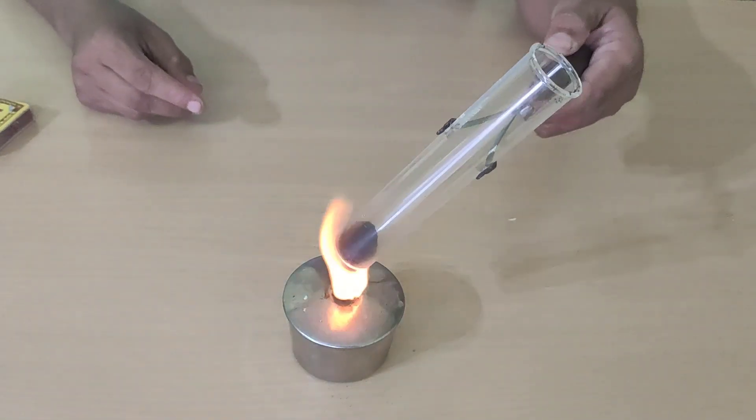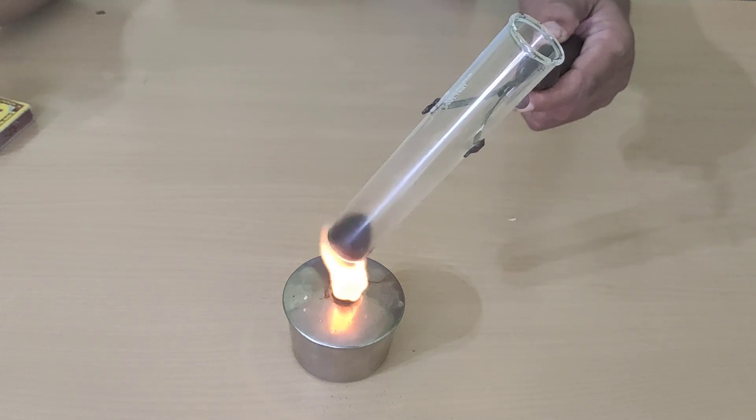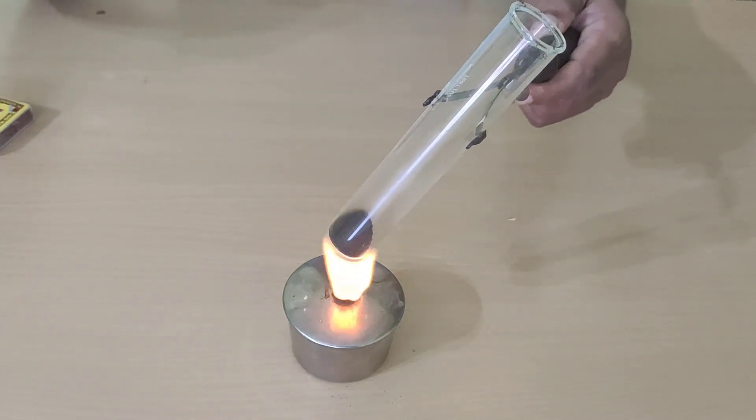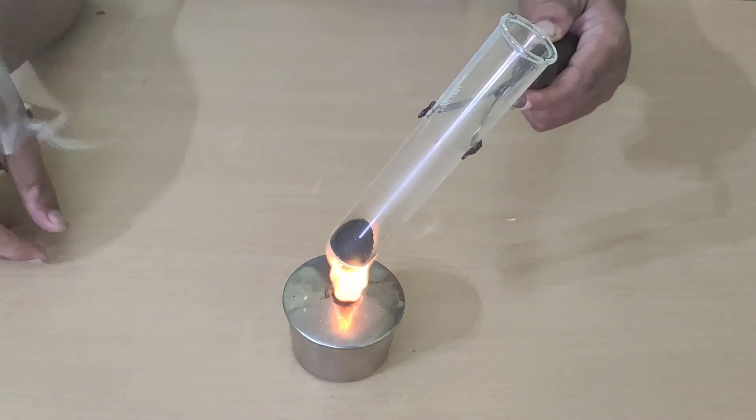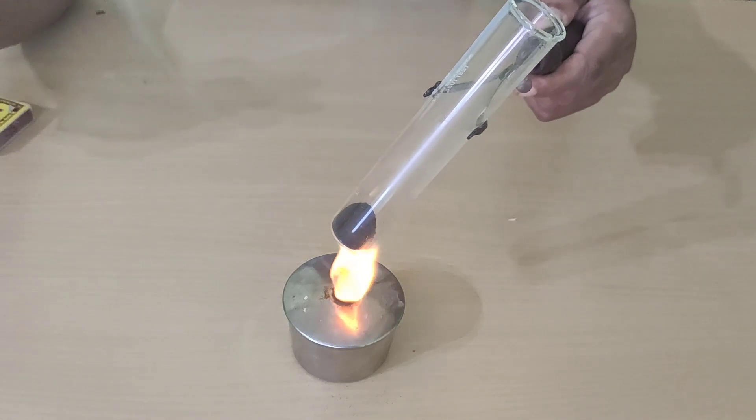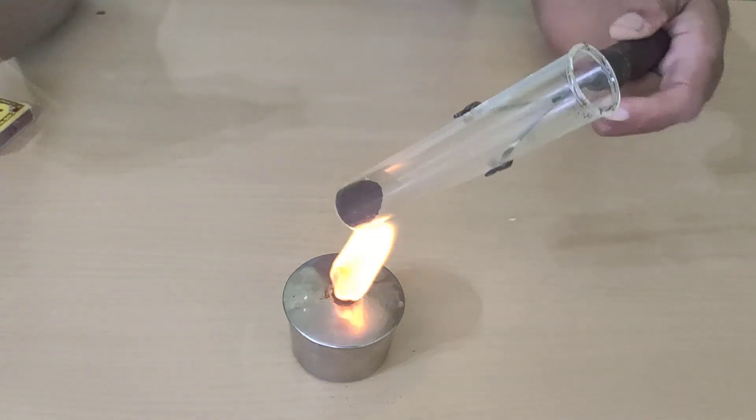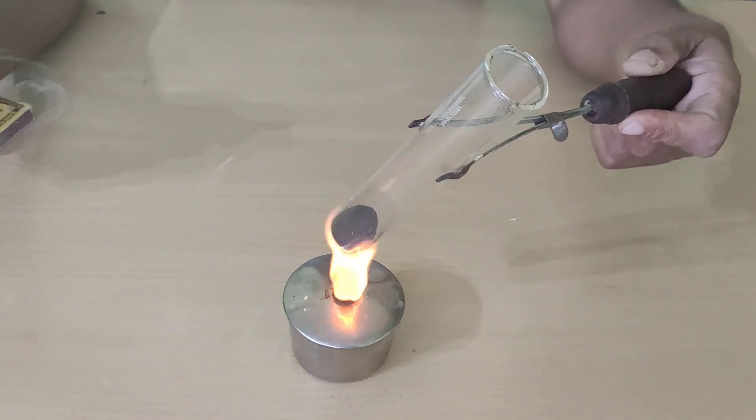Now, we will heat this. Let us see what change takes place in this test tube.